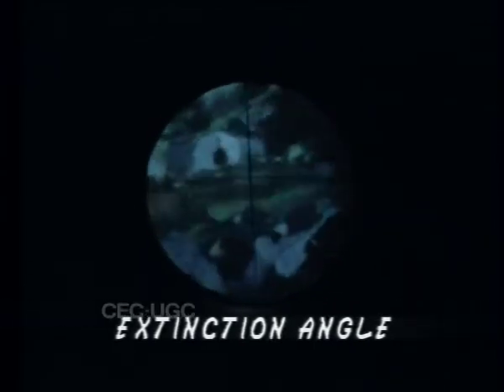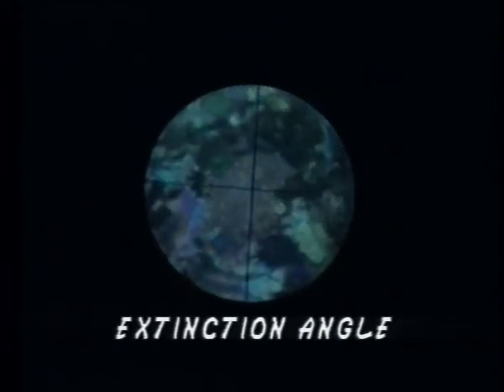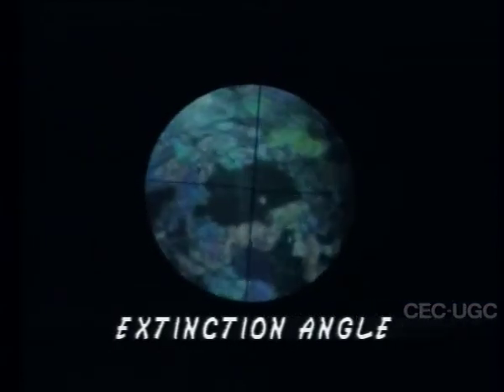It is called inclined extinction. The smaller angle between the reference line of mineral and the hairline is measured as extinction angle. Extinction angles of 15 to 20 degrees are common to amphiboles, while angles greater than 20 degrees are characteristic of pyroxenes.